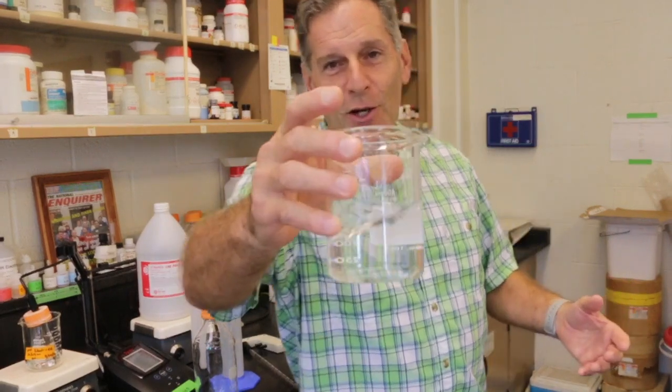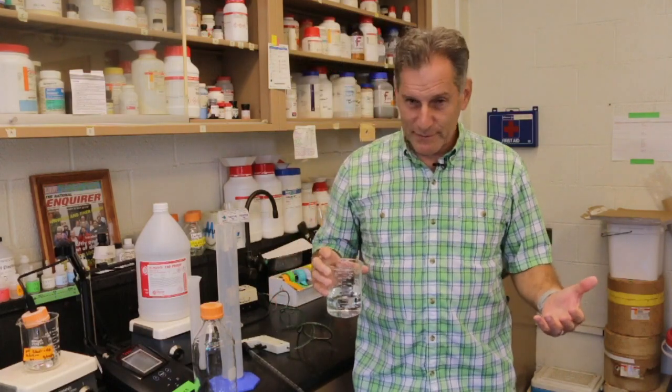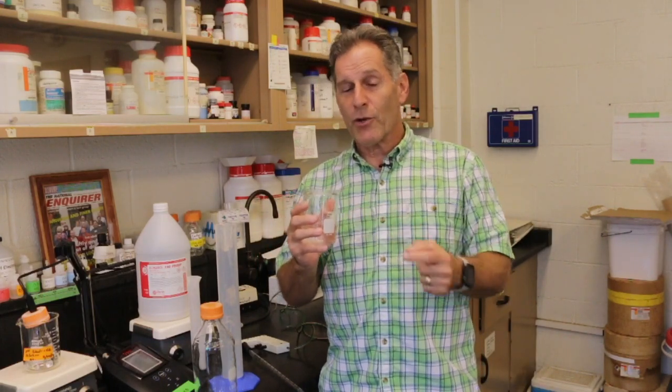All right, so the metric system is largely, in my mind, based on water. So what's right in here is water. Why is it based on water? Well, when you measure a milliliter of water, that weighs exactly 1 gram. That's the basis for this system.